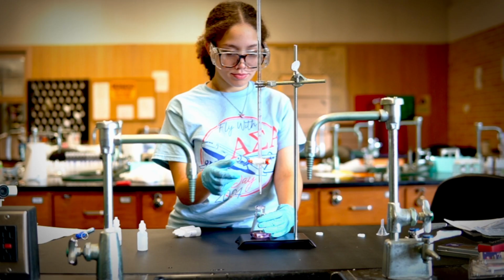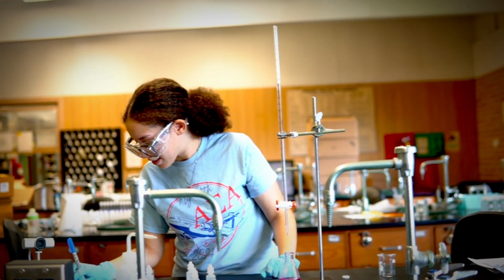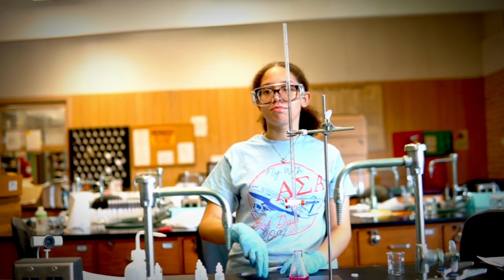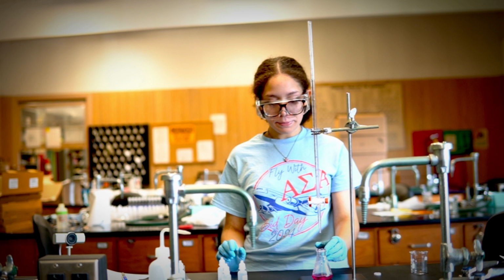So you're going to rinse your beaker. You can keep the same NaOH in your burette, but if you need more, you can add more in your burette, and then you can do another titration from start to finish. And the second titration, you got to be careful, because again, let's say you figure out that last time we added 10 milliliters. This time we are going to add about 8 milliliters, and then when we get there, we start to add it drop wise. Why? Because we want to catch a lighter color, which will be even more accurate.